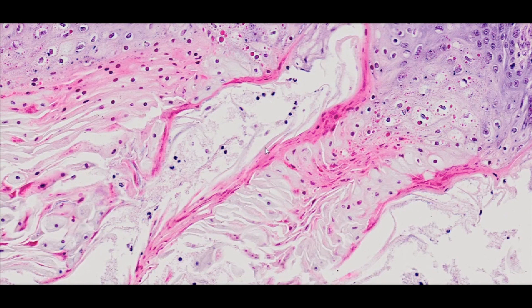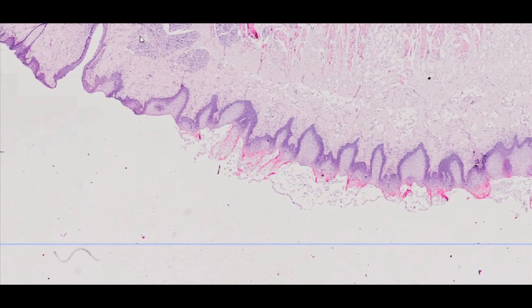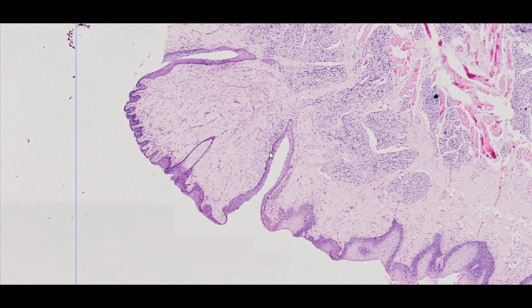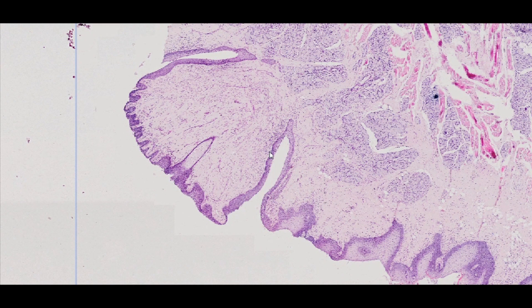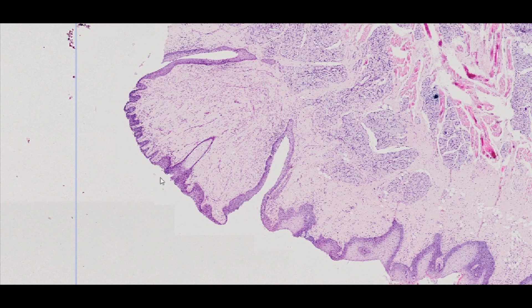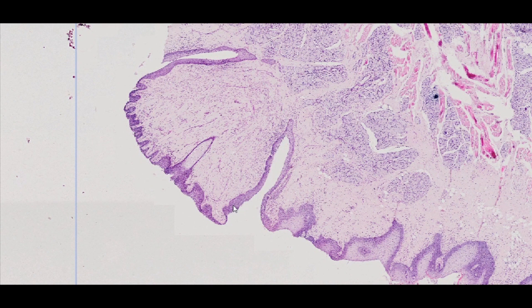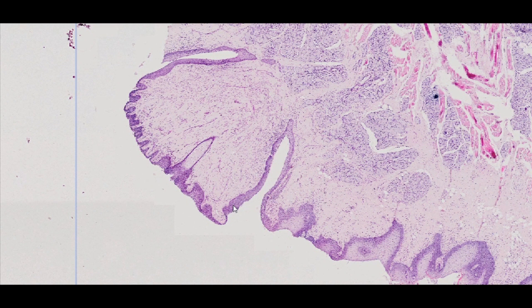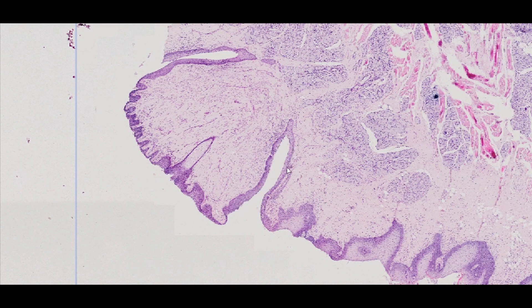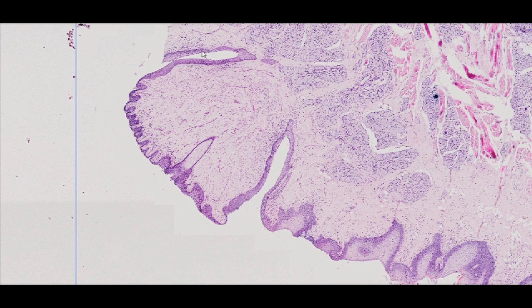Some of the papillae on the dorsal tongue are sensory papillae, responsible for taste sensation. The circumvallate papillae visible in the specimen is an example of a sensory papilla. In humans, there are 10 to 20 circumvallate papillae, arranged in a V-shape just in front of the sulcus terminalis. Each circumvallate papilla is large, reaching down below the dorsal surface of the tongue. It is clearly surrounded by the peripapillary trench, which then turns into the peripapillary furrow.